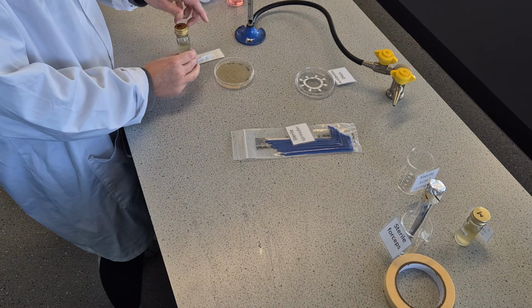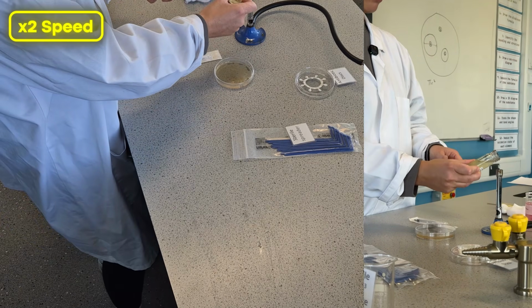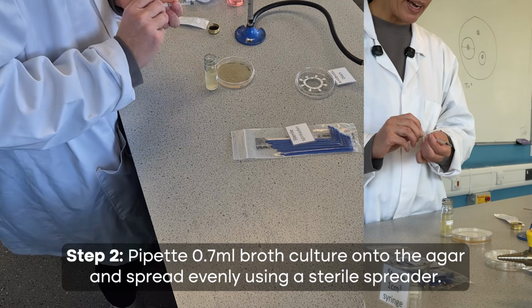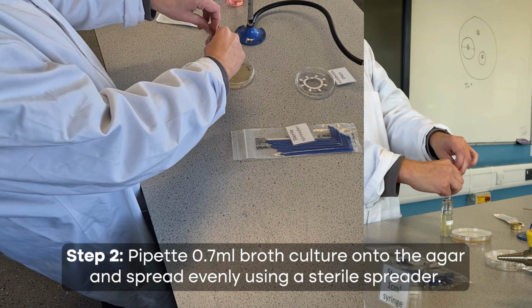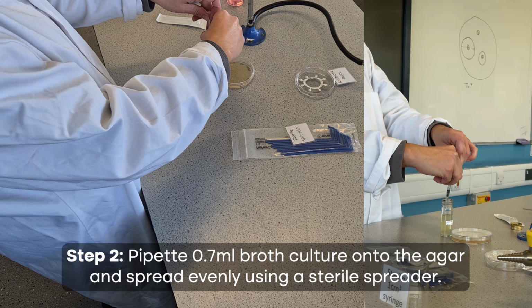First of all then, I would flame the neck. Now I'm going to open up and get my syringe out, and we actually use 0.7 mil when we do this. We found that that's enough to get good results, that we can actually see the growth and not so much that it's really wet and splashes around on the plate.